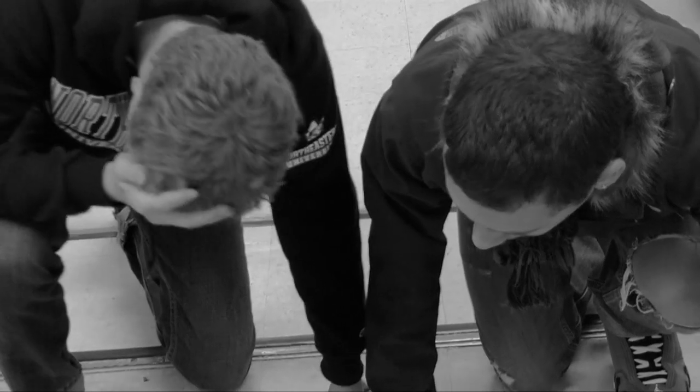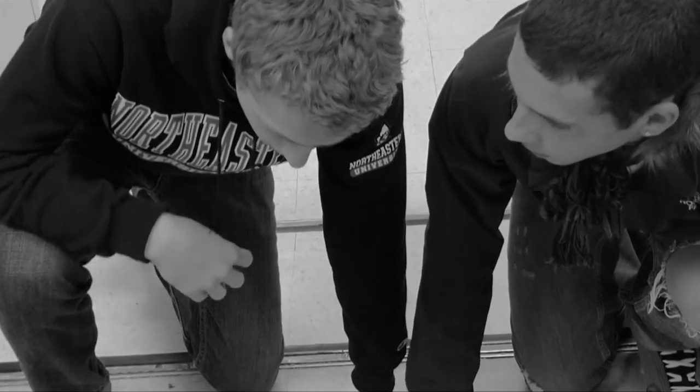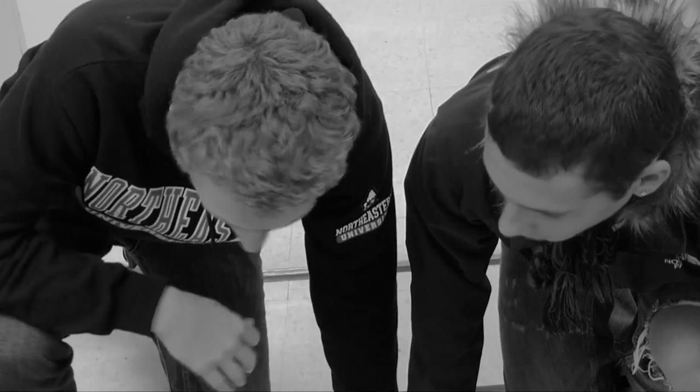What do we do? Should we leave him like this? I don't know. Should we try CPR or something? I don't know. What if they think we did it? Let's get out of here. Come on. Let's just go.